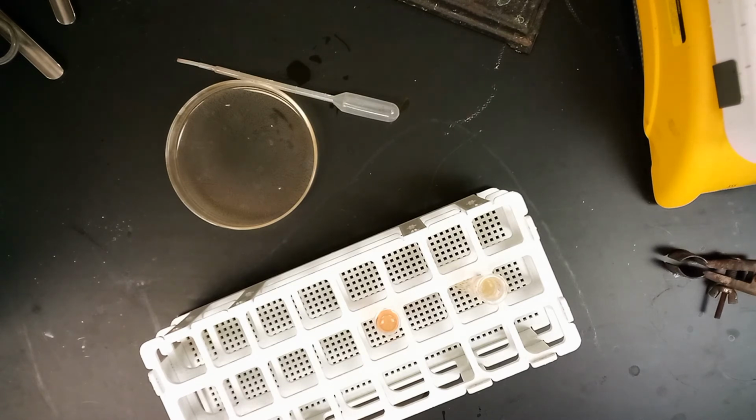So hopefully that tells you a little bit about Le Chatelier's principle and how it really relates to heat in this reaction, whether adding heat or taking away heat shifts the equilibrium to the right towards the products or to the left towards the reactants. Again, the color change is useful because the complex ion is that darker shade of red, whereas the reactants are more clear. So hopefully that gives you a little bit of indication for what's going on there.